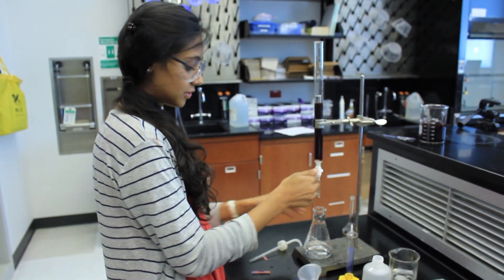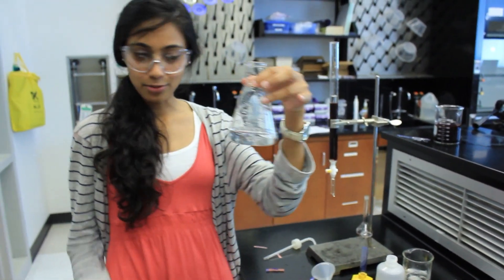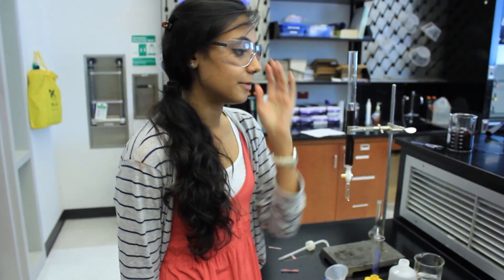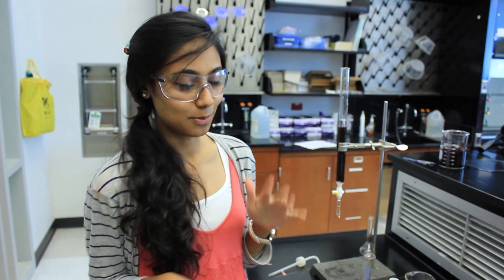After your effluent is neutral, that's your REN1. You'll take that off to be titrated by NaOH to get the content of cobalt.